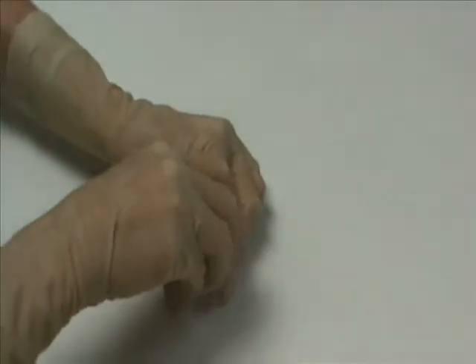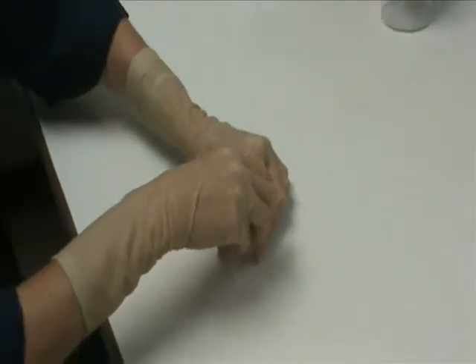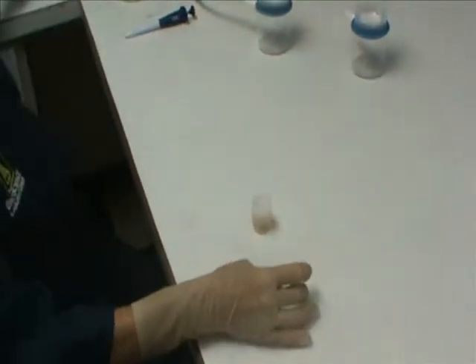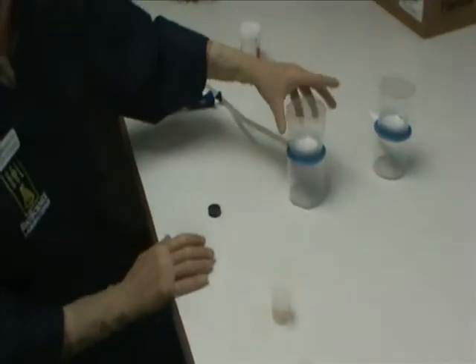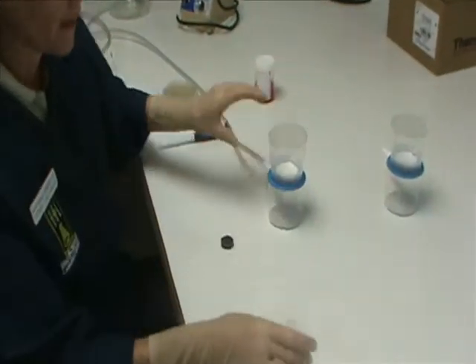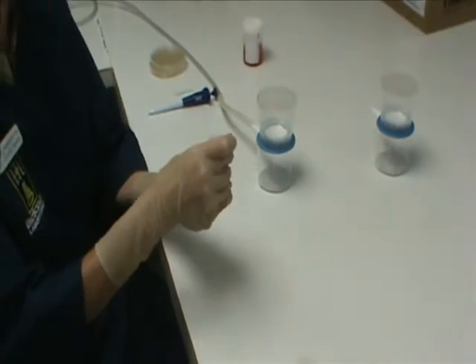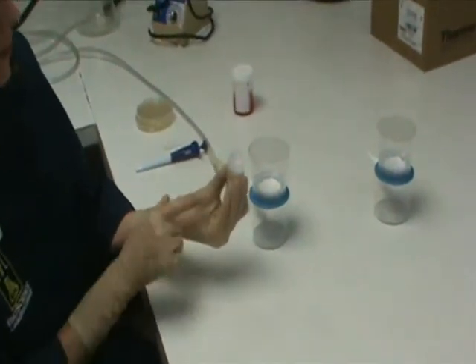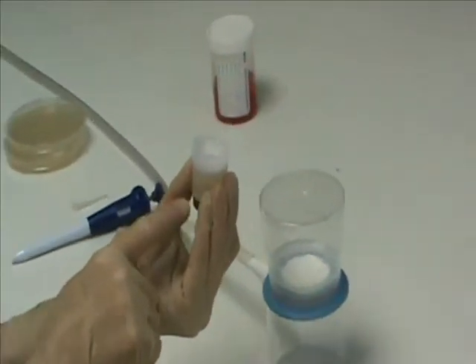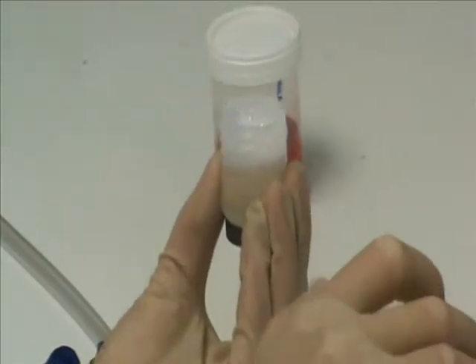At this point, the sample is plated. This is done with a .45 micron filter. A magnet is used to hold the magnetized stainless steel disk in the bottom of the specimen cup.